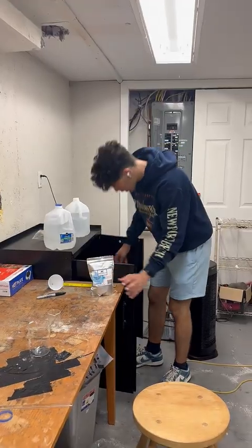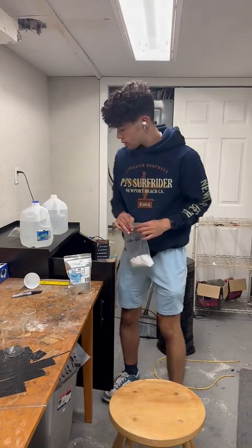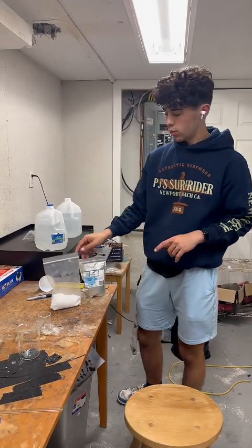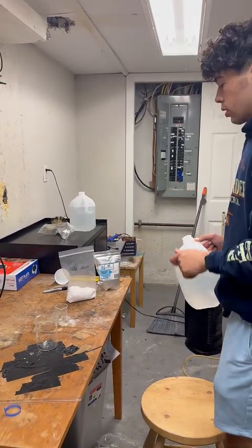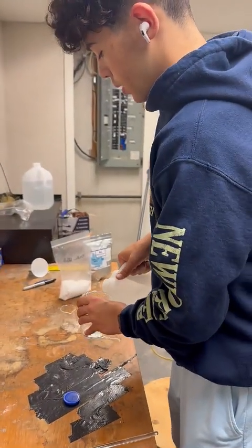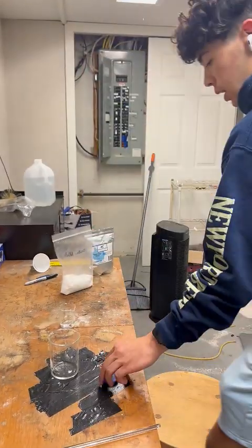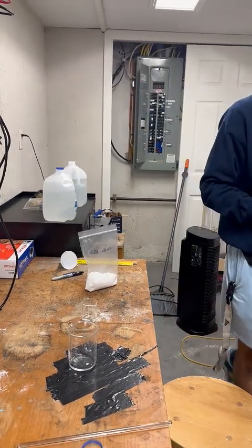So I have my copper sulfate, and I have my oxalic acid. And you want to make a solution of both individually. So I'm going to only do a very little bit because I'm not actually going to be using this, just to show the chemistry. So a little bit of distilled water in each, and I make a saturated solution of copper sulfate. So I have excess, so I don't need to measure it.